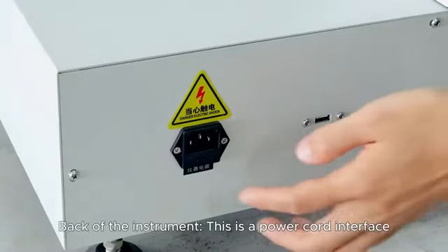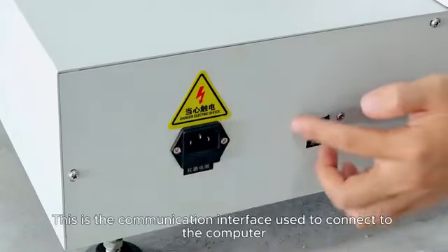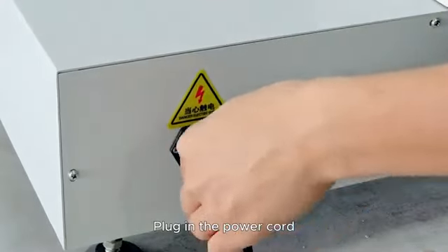Back of the instrument, this is a power cord interface. This is the communication interface used to connect to the computer. Plug in the power cord.